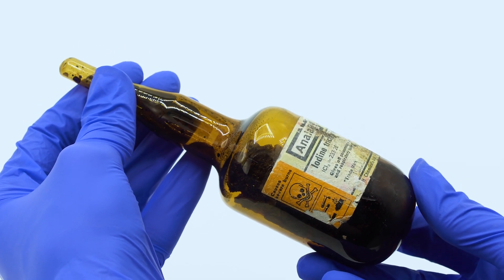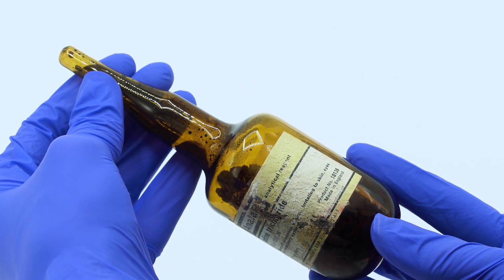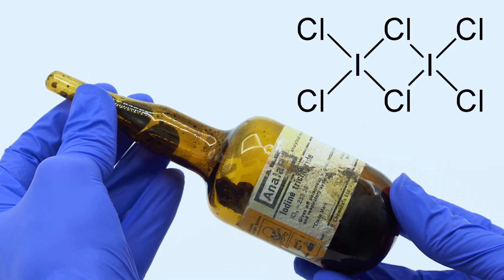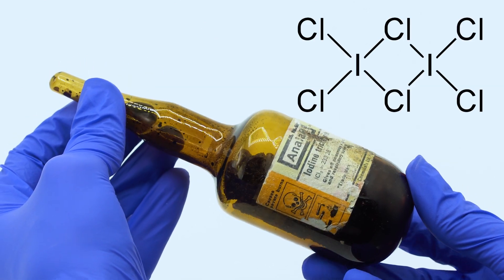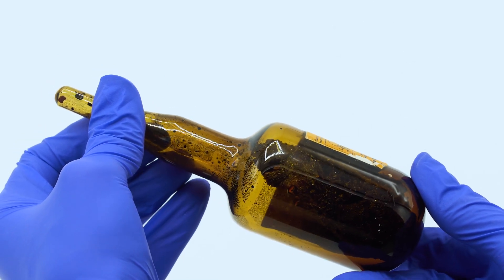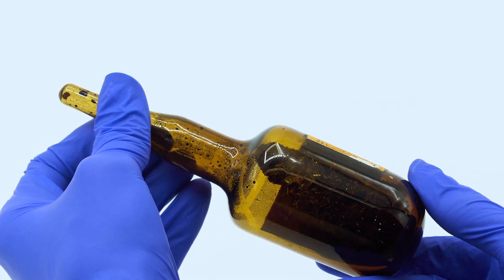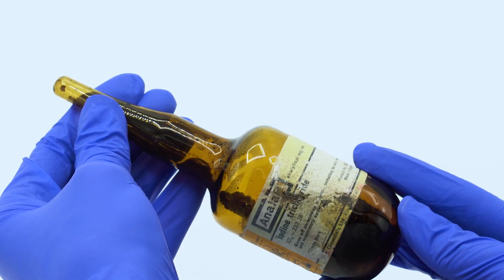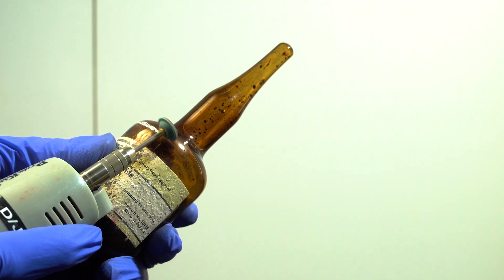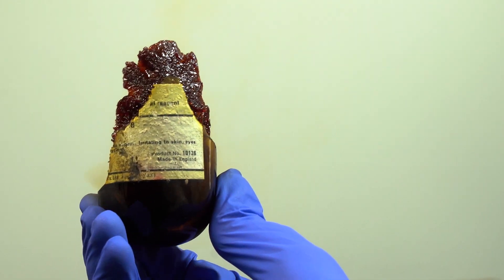I'm holding an ampoule with iodine trichloride, also called diiodine hexachloride sometimes, because in the solid state it is presented as a dimer. Let's open the ampoule. This must be done very, very carefully.